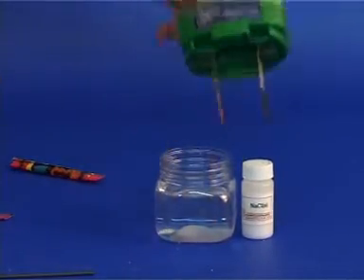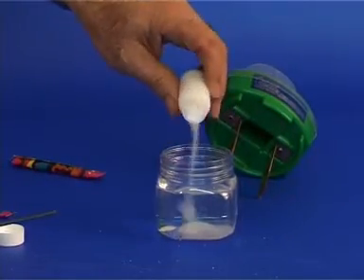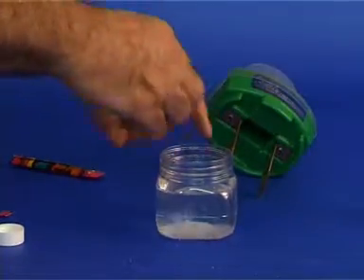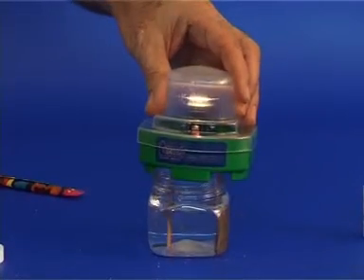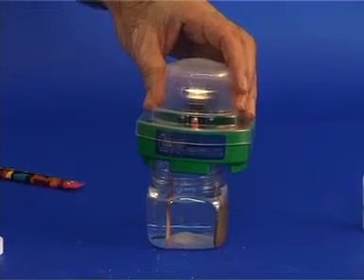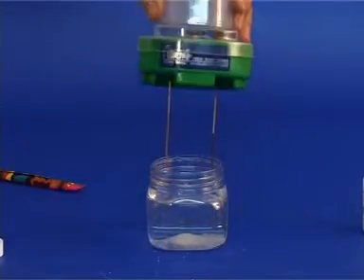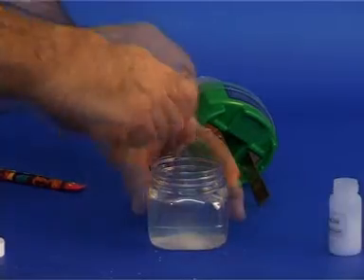Next we shall add a small amount of salt into the sugar solution and stir it vigorously. Observe the light in the conductivity device. Alternatively, we can use fresh tap water and dissolve a small amount of salt into it. Add more salt and once again observe the intensity of the light.